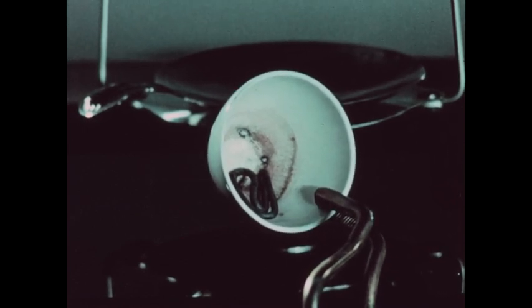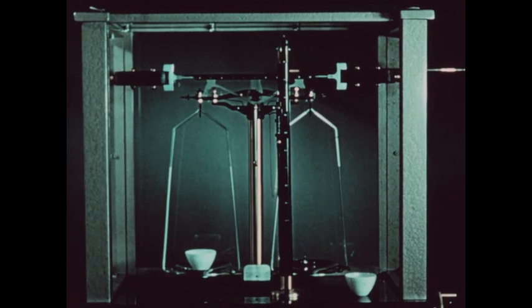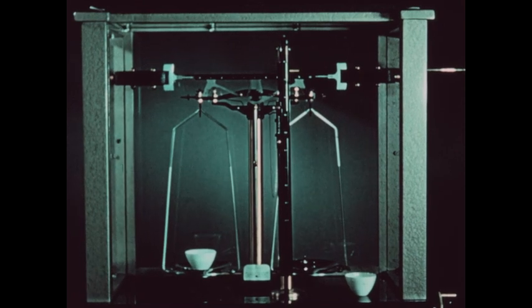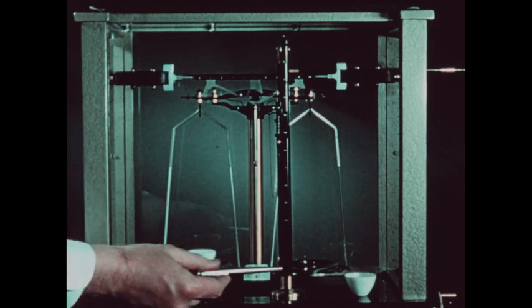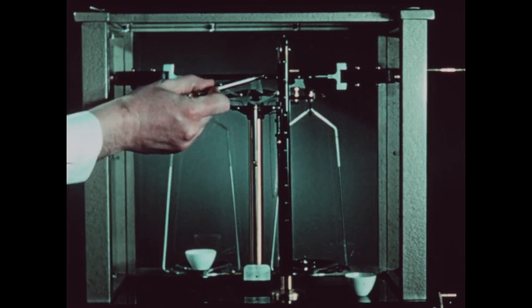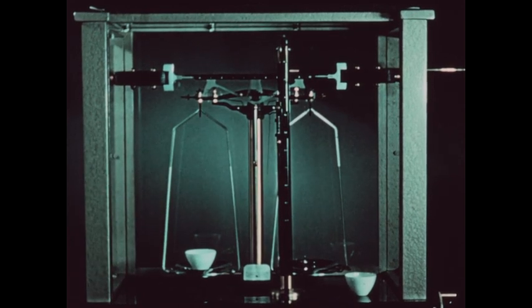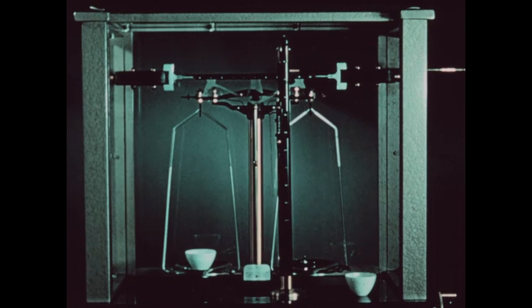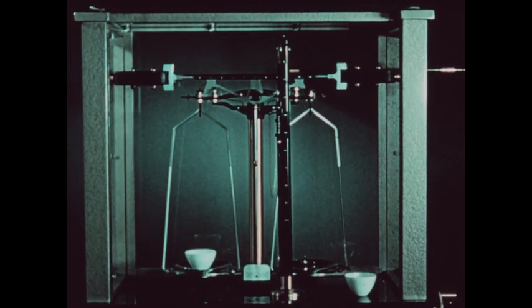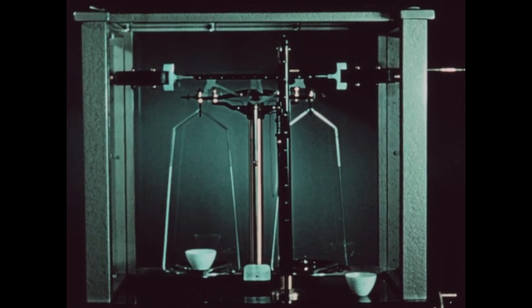Our next step is to determine the weight of the crucible and the cuprous sulfide it contains. We will now re-weigh the crucible and its contents. On the right-hand pan we placed 11 grams in large weights, seven-tenths of a gram on the rider, and 41 thousandths of a gram from the chain, making the weight of this crucible and its contents 11.741 grams. The second crucible has also been weighed and its weight is 11.832 grams.